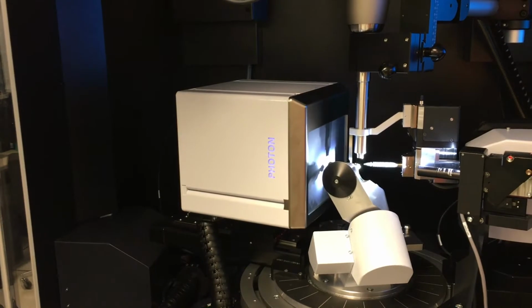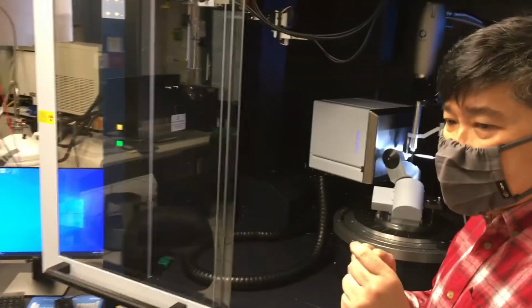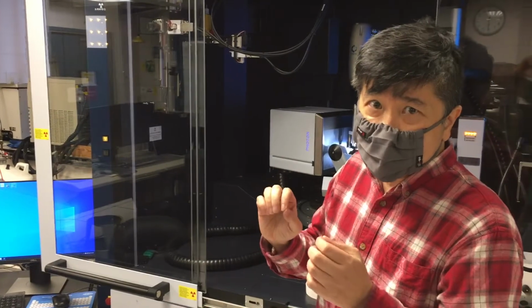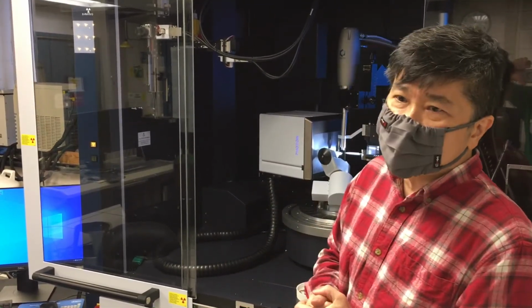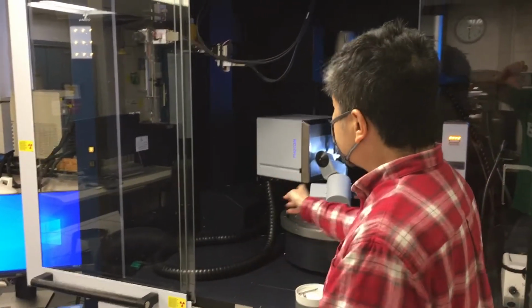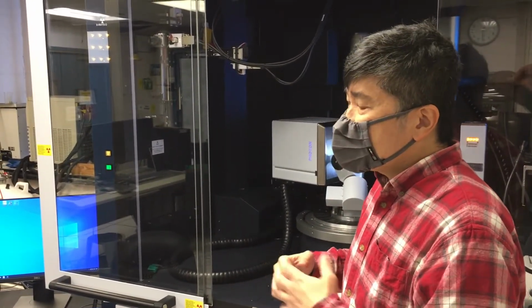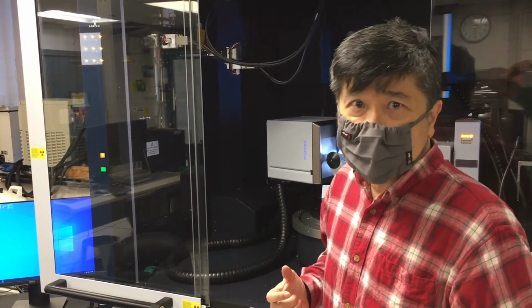the diffraction pattern. And in the old days, what we do is we do a serial detection, wherein you have to go and drive from point to point and measure that spot. Then later on, the technology was improved, and we were taking snapshots. This unit detector does it in a movie fashion. So the net result is that we're getting data at a much faster clip.